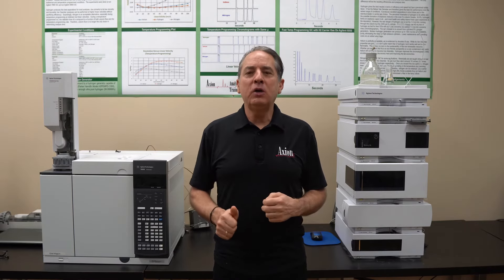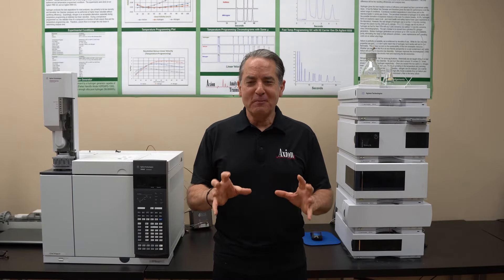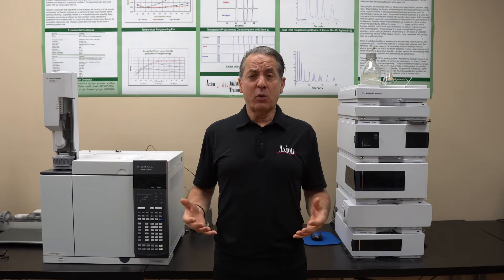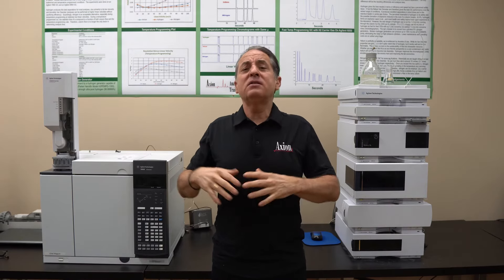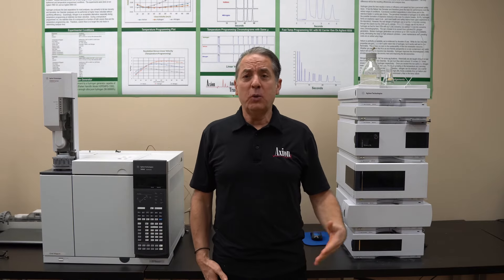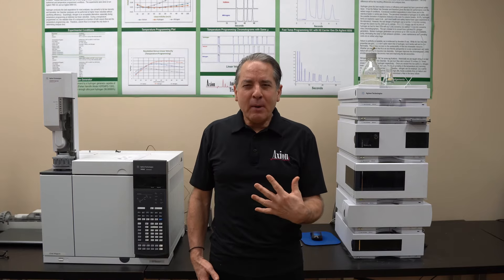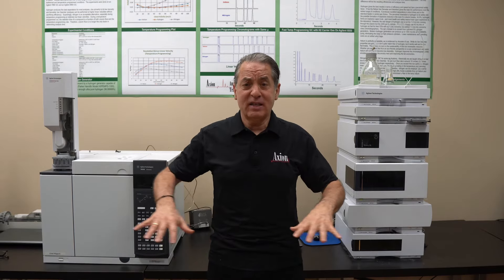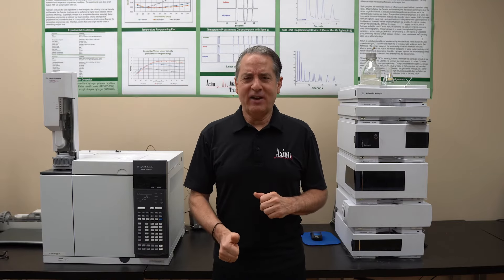What is my standard set of conditions? First, we choose a good reverse-phase base-deactivated C18 column. In the HPLC world, we could choose different stationary phases — the most popular one is C18, which is 18 carbons stuck onto the column. There are dozens and dozens of different C18s; there are good ones and bad ones, old ones and new ones. The bottom line is you want a base-deactivated C18. These are end-cap columns or sterically protected — you really want to make sure there are no acidic sites in the column. It has to be a very neutral column.